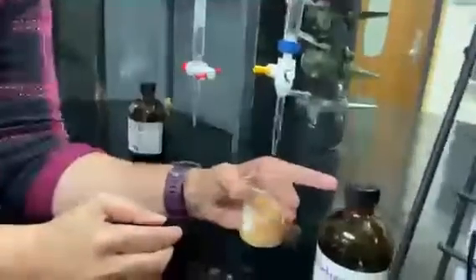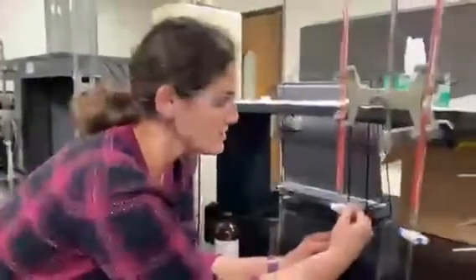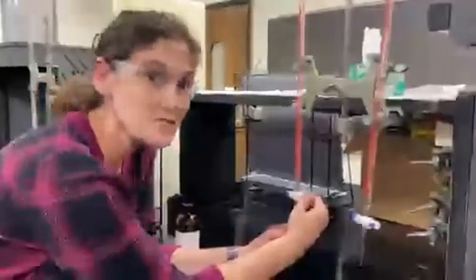And then, all right, now we've got that nice reddish color. And this one took almost exactly 5 mLs. I would say maybe 4.90 or 5.0. I'll take a closer look when I record the data. Our third solution, okay? Now, this is the one that has the silver nitrate also present. So keep in mind, that's 2 sources of silver.